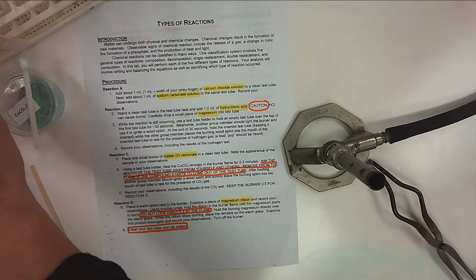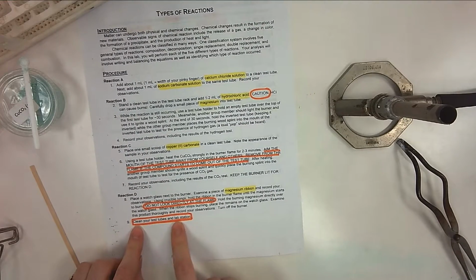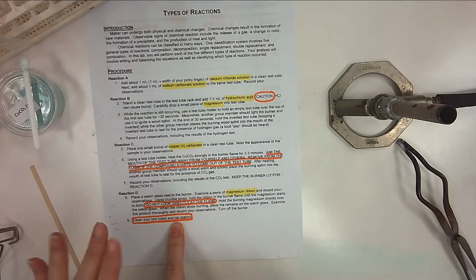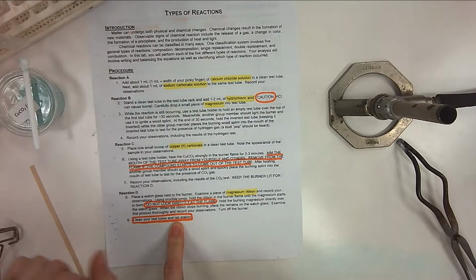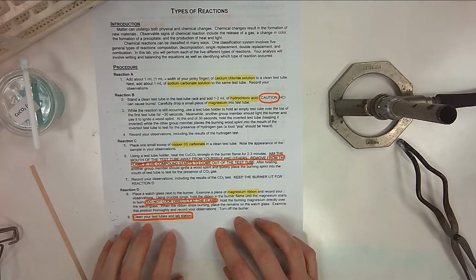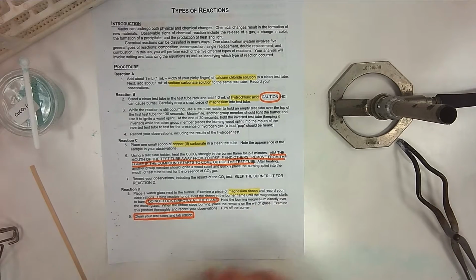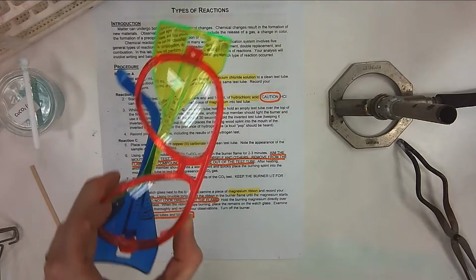All right, at this point, you will go ahead and start to clean your test tubes in your lab station. So rinse everything down the drain with plenty of water, and set them out, maybe even on a dry paper towel. All right, you're going to put everything back up as well. So clean your space. I want it to look like you weren't even there. No one was there. And your goggles can be put away as well.